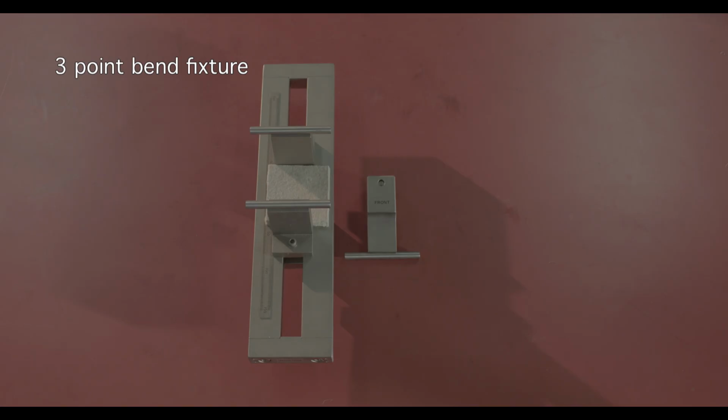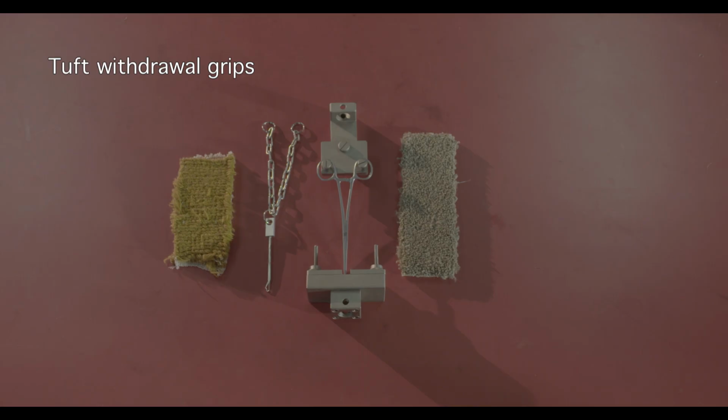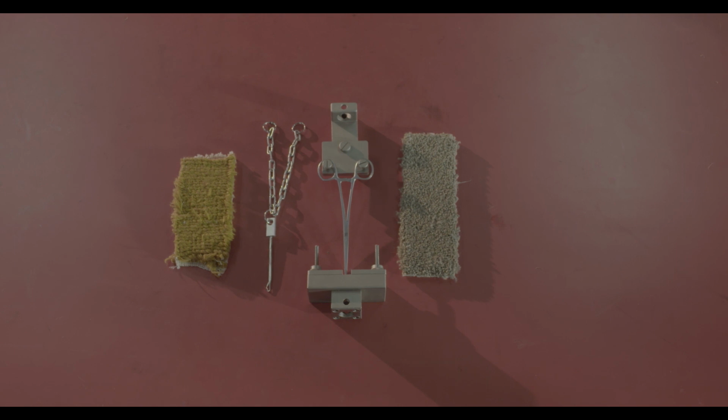Three-point bend fixture. Variable span three-point bend fixture is used to measure the flexural test of polymers, composites, etc. Tuft withdrawal grips. Tuft withdrawal fixture and forceps holder are used to measure the tuft withdrawal force of cut pile material. Tuft withdrawal fixture and hook are used to measure the tuft withdrawal force of loop pile material.